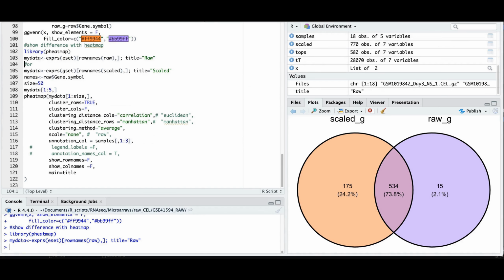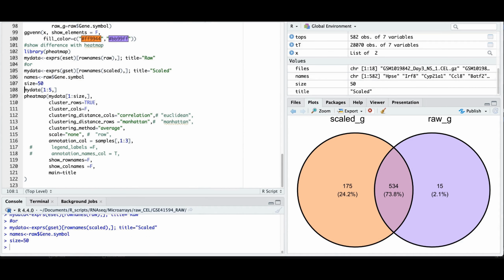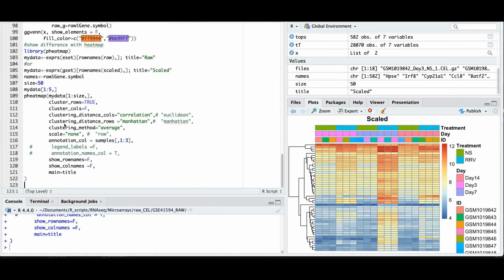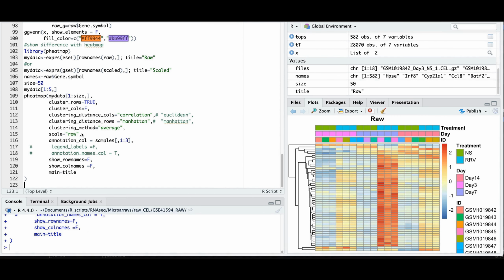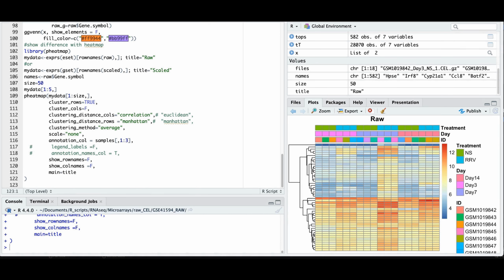You can also experiment with the heat map and see how different are scaled data from raw data. Strangely, scaled data still need rescaling for a proper heat map, but this is rudimentary to the major question: what to do with the scaled data and how to replace it with the raw data, and I hope you got the idea.